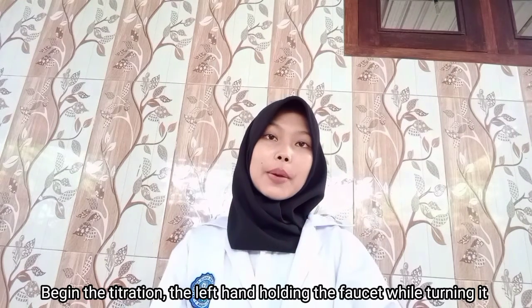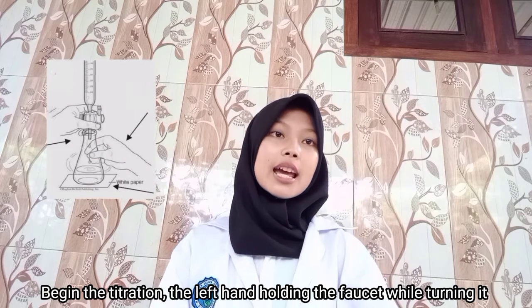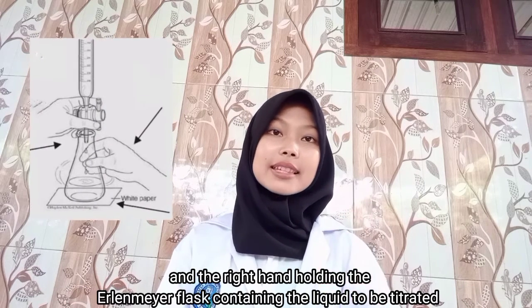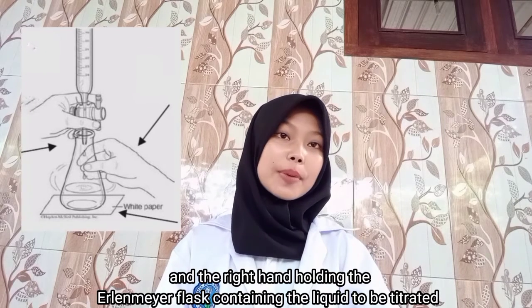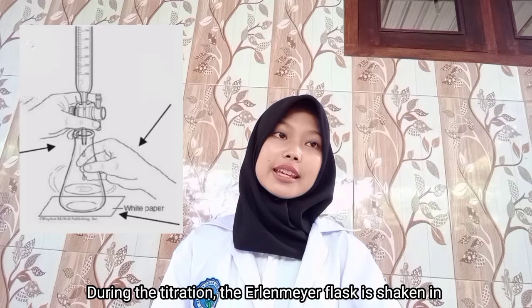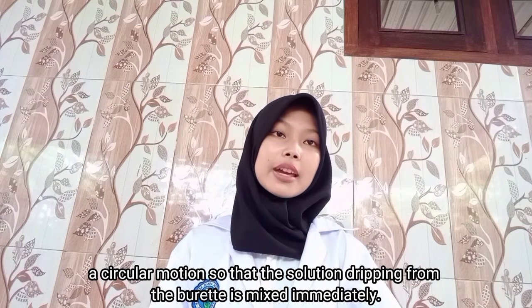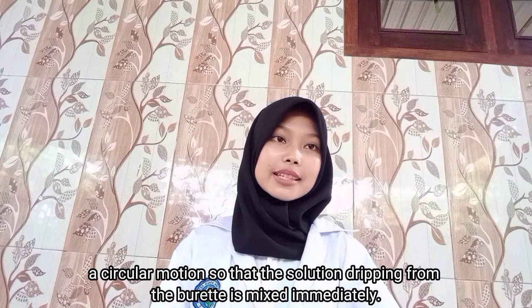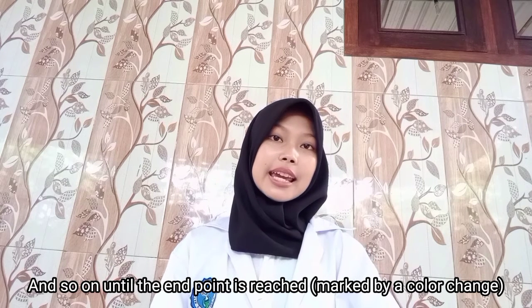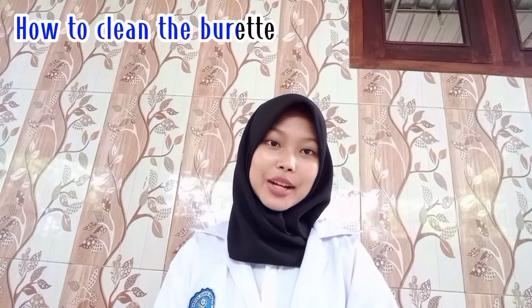6. Begin the titration. The left hand holds the faucet while turning it and the right hand holds the Erlenmeyer flask containing the liquid to be titrated. During the titration, the Erlenmeyer flask is shaken in a circular motion so that the solution dripping from the burette is mixed immediately, and so on until the end point is reached, marked by a color change.